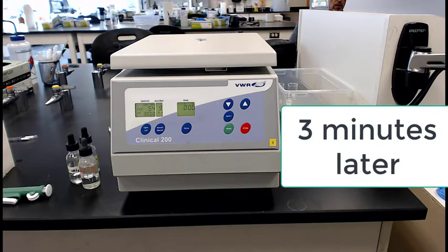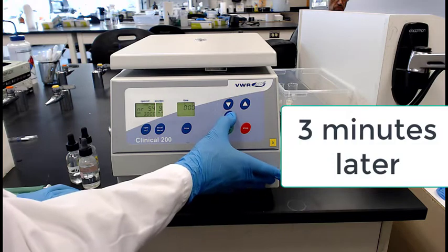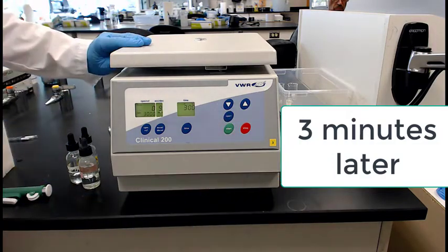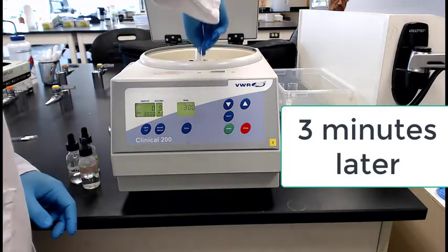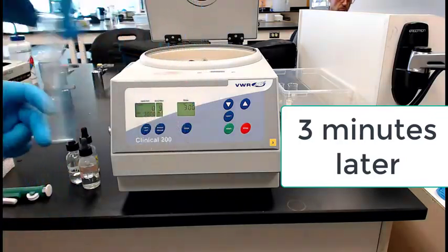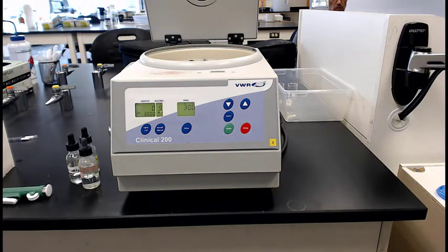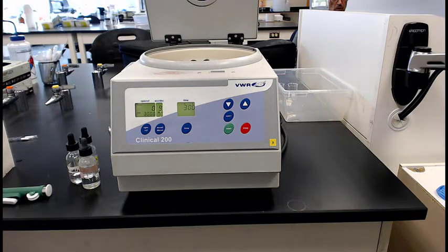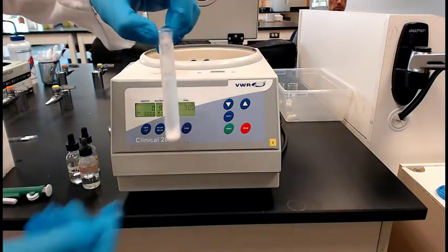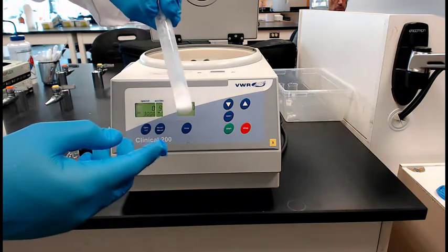So now through the beauty of chopping the film, 3 minutes of your time just got saved. So now he's done. He's going to pop the lid open and he's able to pull up the counterbalance tube. So he's going to put that somewhere. Not the important tube. There we go. Here's our product. Now look what's happened. See, it's settled all the precipitate down to the bottom and the liquid's on top.